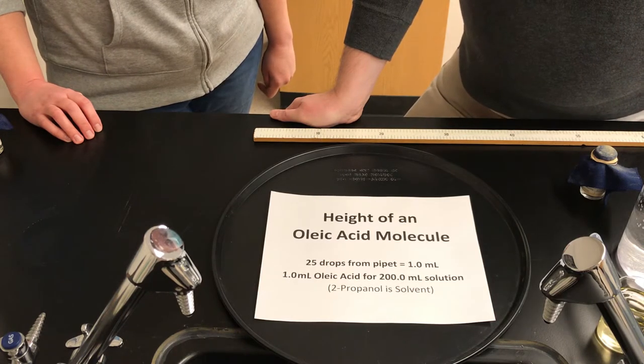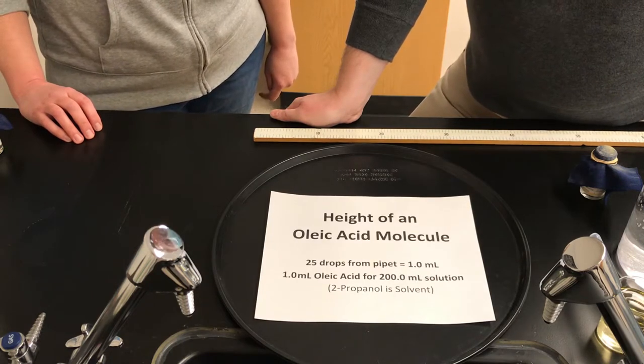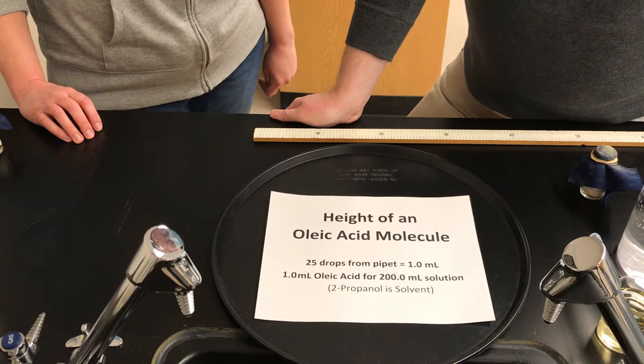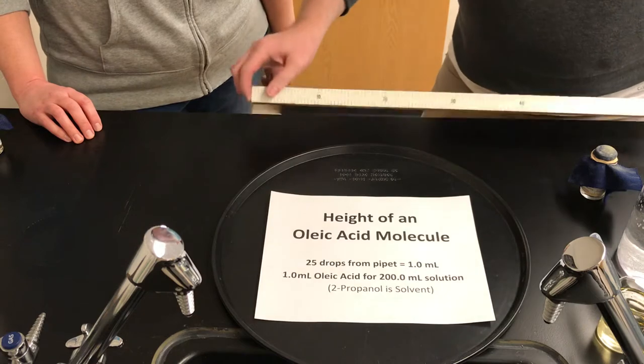In this experiment we're going to be looking at the particles that make up compounds, specifically molecules, an incredibly small thing, and we're going to be trying to find the height of that molecule using a meter stick.